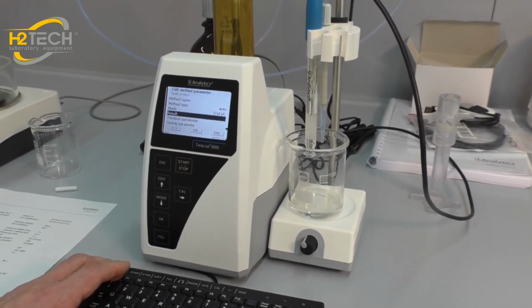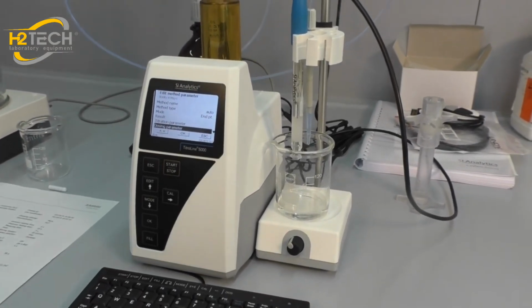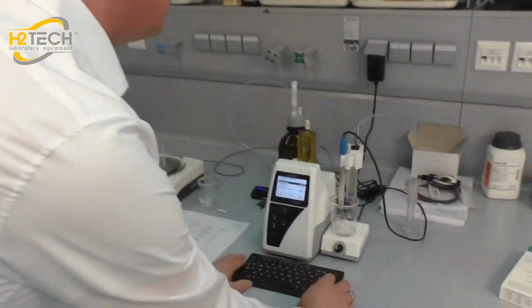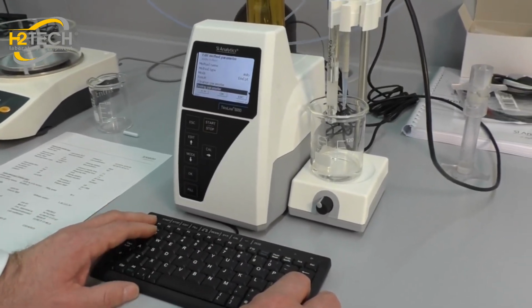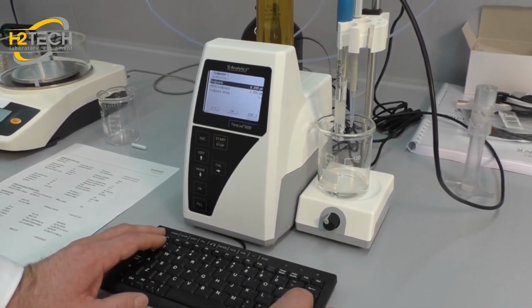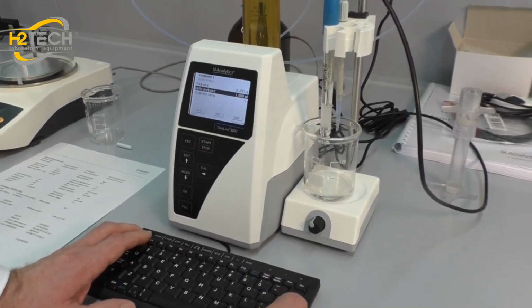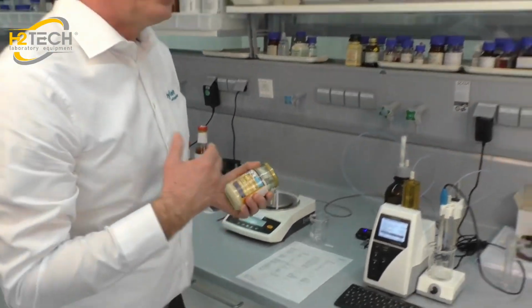and that's fine. Next we have to change the dosing speed and the titration parameters a little bit, because if we use the standard parameters from the total acidity in juice, the titration will be too fast and over-titrate. We will change the endpoint. It's the same, sorry, but the delta endpoint 1.2 is a little bit too small. We will change it to 1.8.